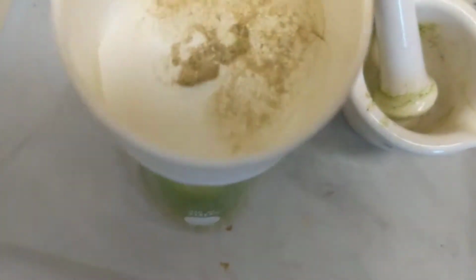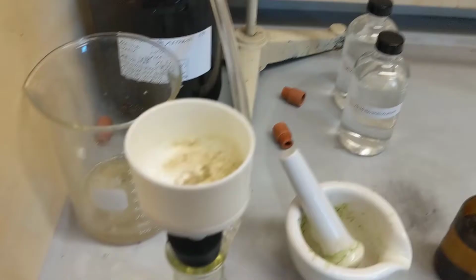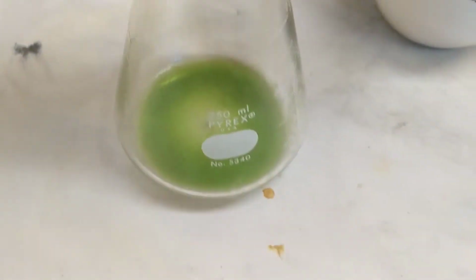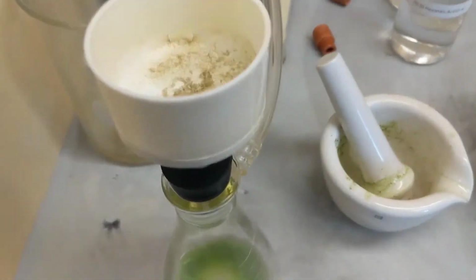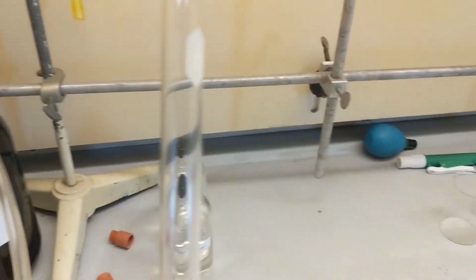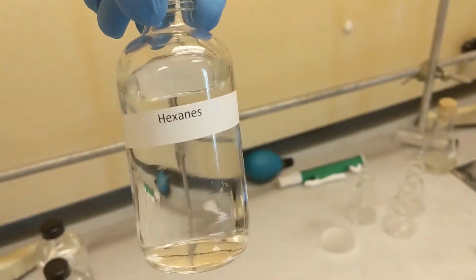As you can see, that is the leaves I started with, right? The solids. You can see there's no color left in them. They're colorless. I pulled out the pigments into my acetone. Okay, and sorry the clips are shorter now, but I have to move quickly because acetone is highly volatile. So what I'm about to do is take all that pigment, put it into this test tube, and add 3 milliliters of water and 7 milliliters of hexanes.